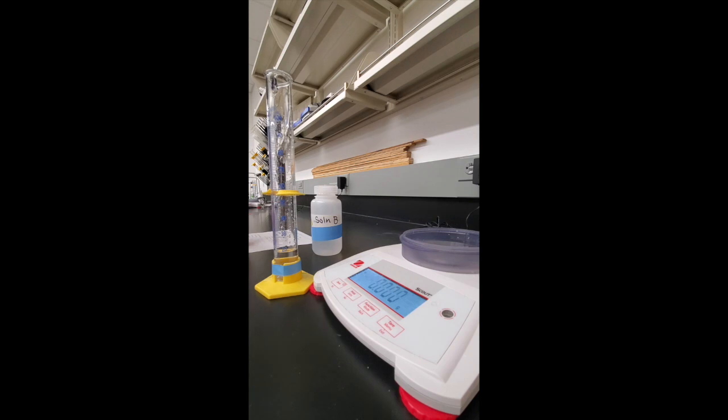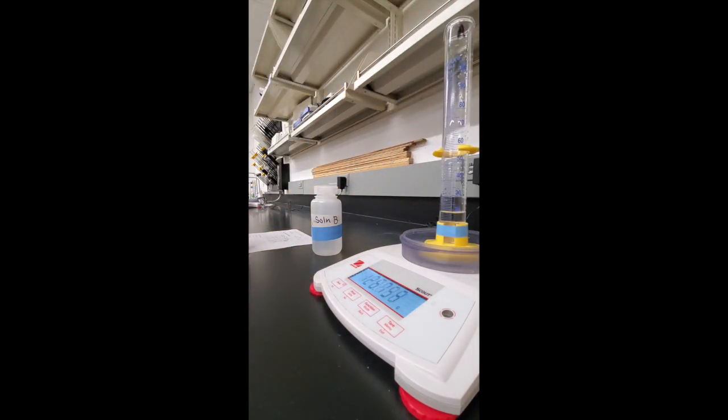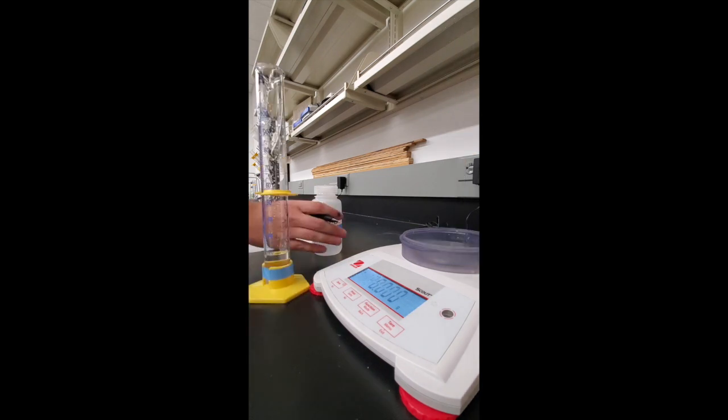Measurement number one has a volume of 19.5 milliliters and the mass is 126.753 grams.